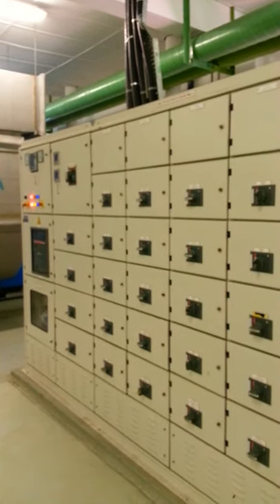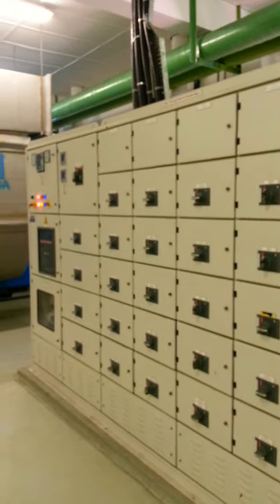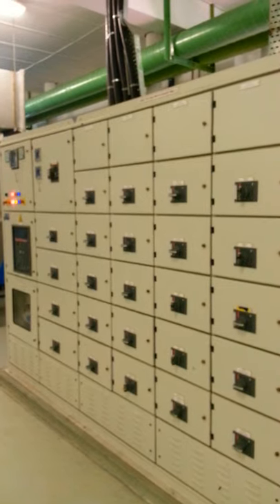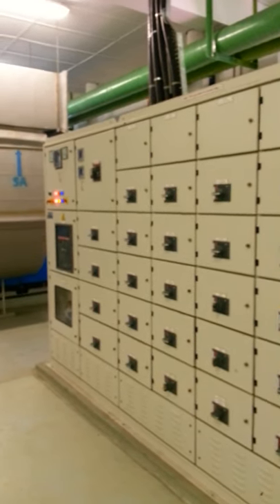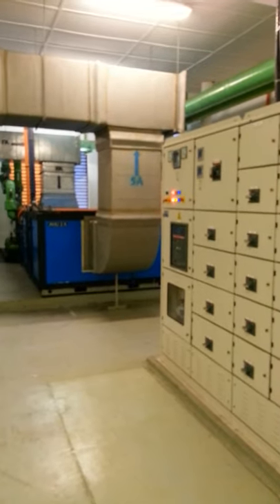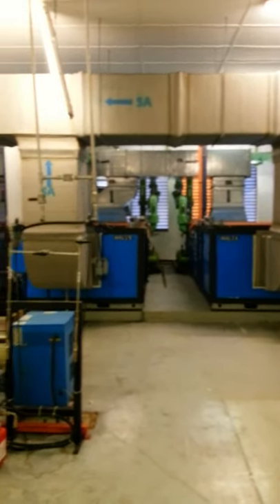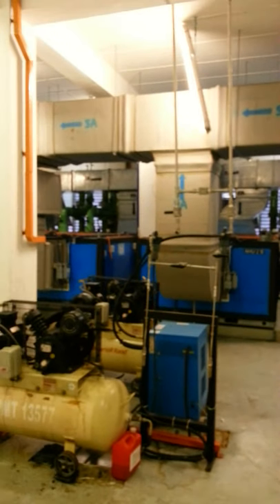Hello and welcome to this massive open online course, Introduction to Biorisk Management. In this short video, which will accompany your lecture slides, I will be discussing the engineering controls with specific reference to the facility design and the instrumentation associated with this particular facility.